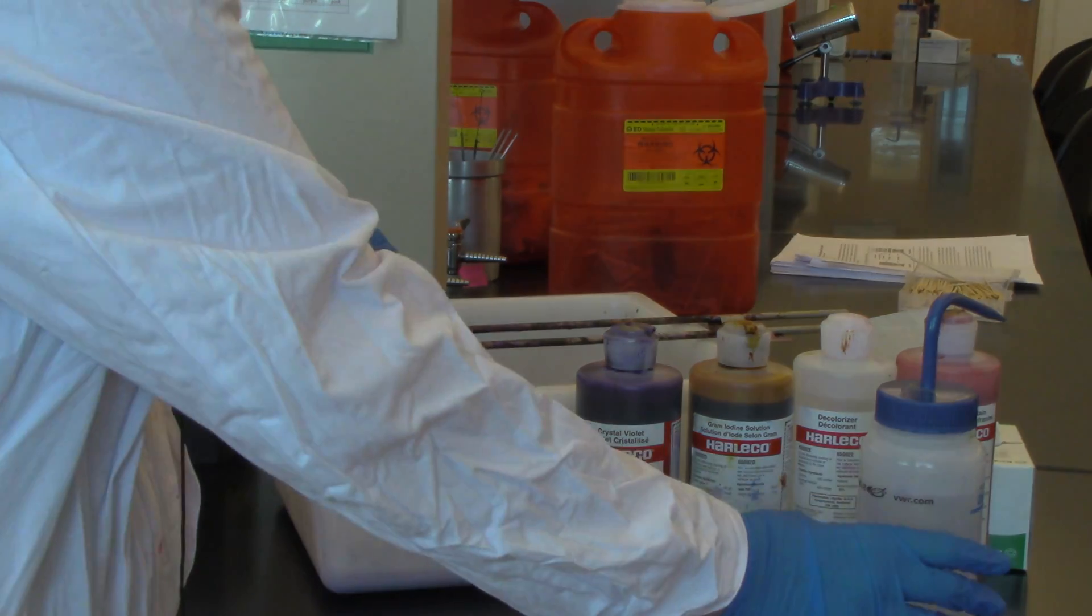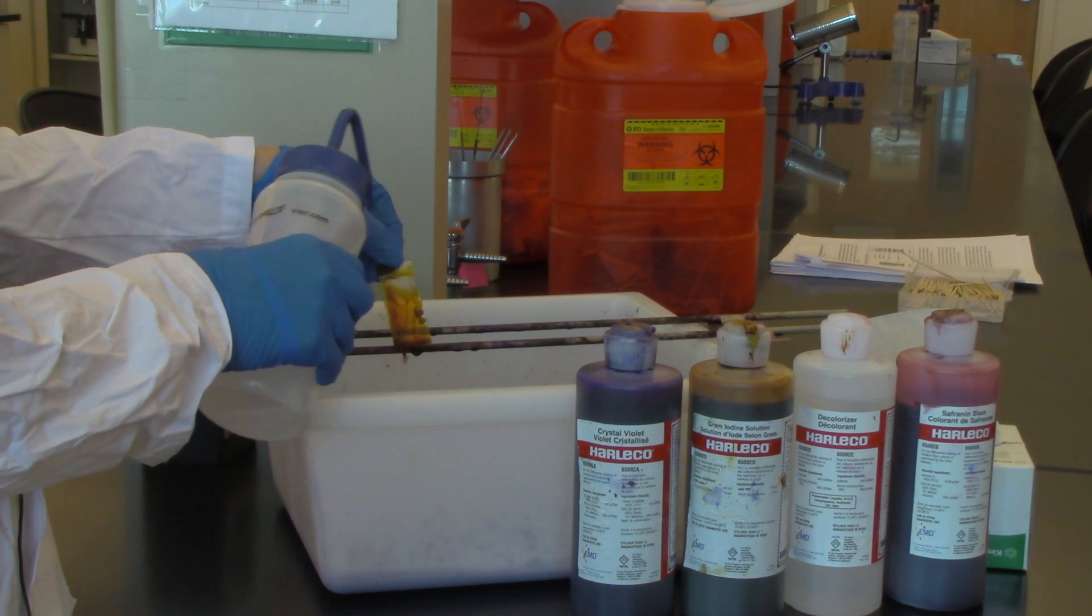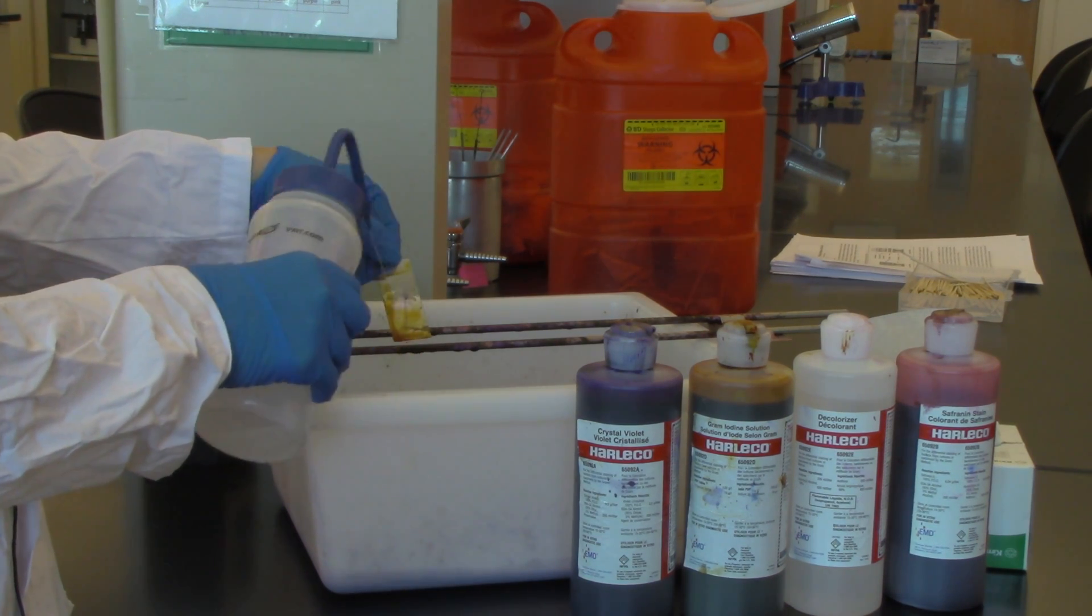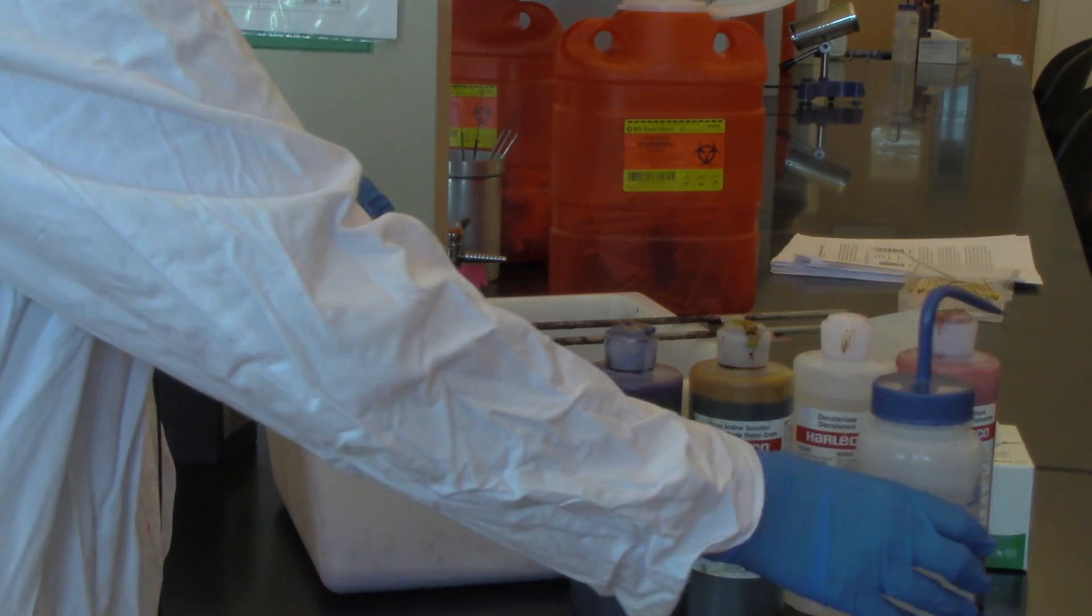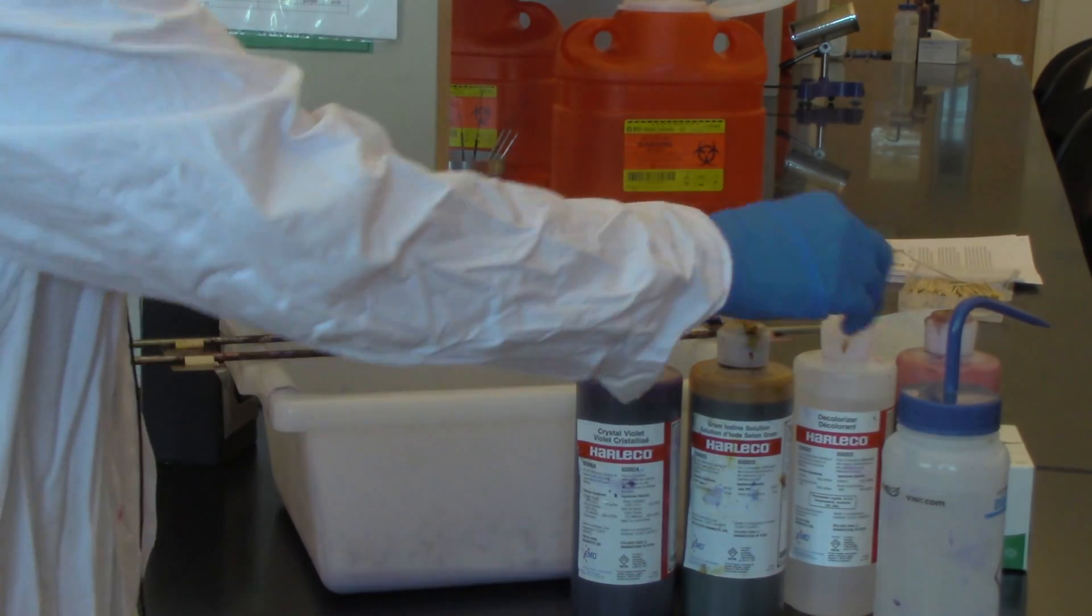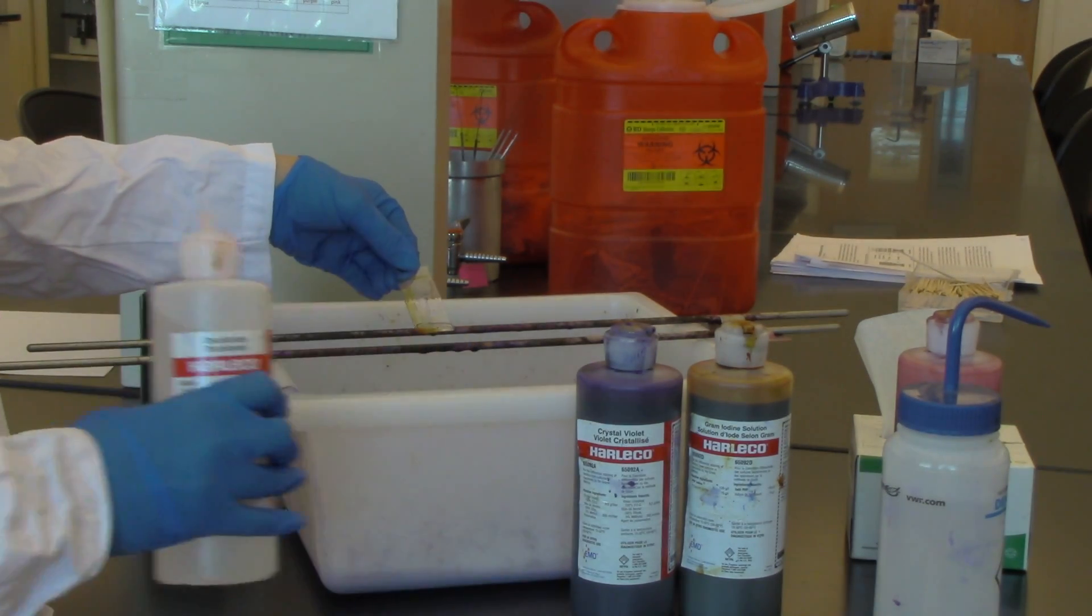Okay, it's been 30 seconds. I'm going to now do my five-second rinse just like I did before. Now I'm going to move on to the decolorizer step. This has to be a very quick step. As soon as you start decolorizing you need to rinse it off.